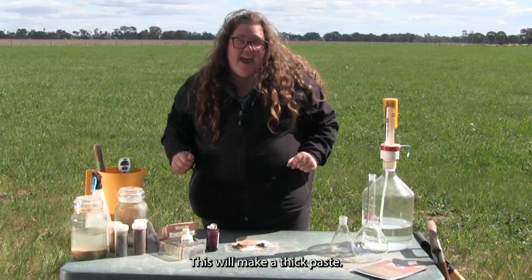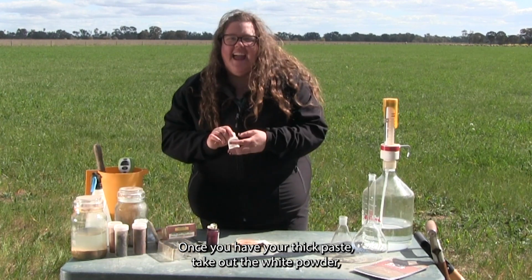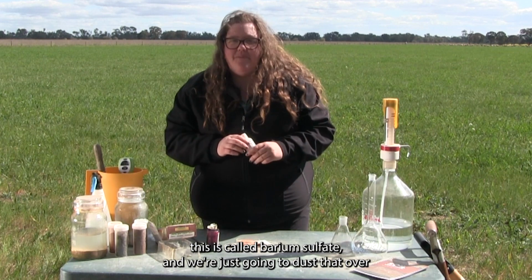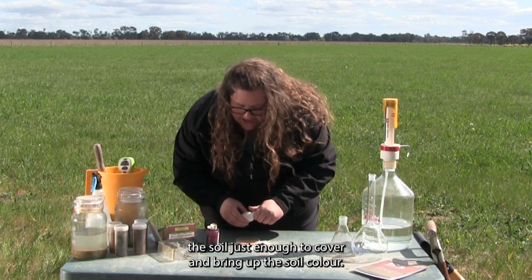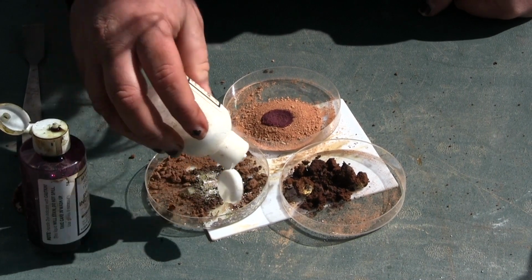This will make a thick paste. Once you have your thick paste, take out the white powder, and this is called barium sulfate, and we're just going to dust that over the soil just enough to cover and bring up the soil colour.